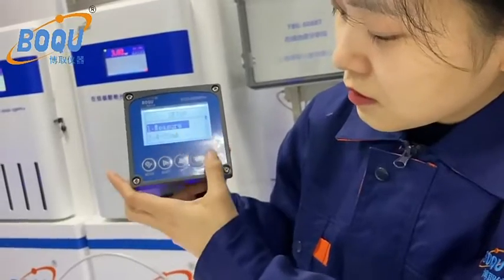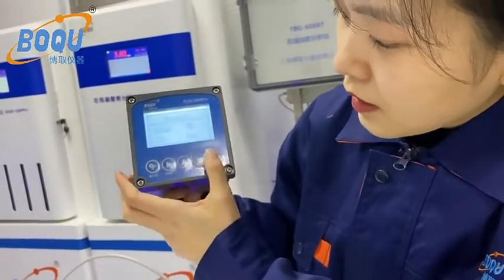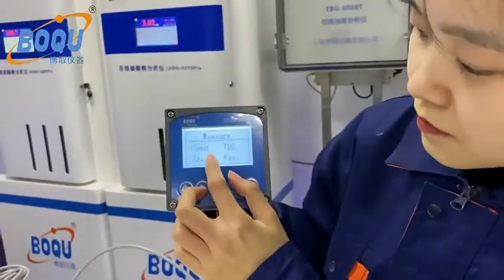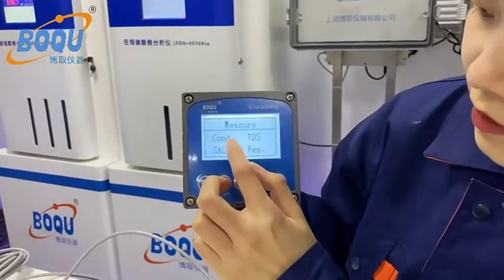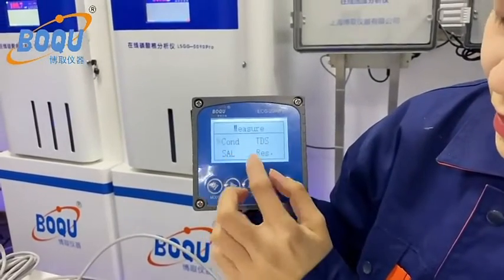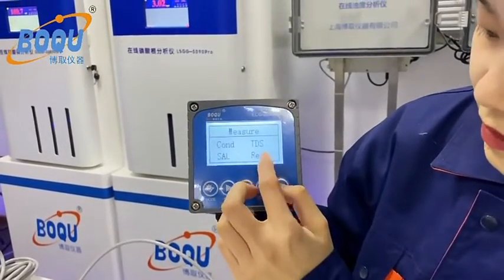The first one is measure. It can measure four parameters: the conductivity, the TDS, salinity, and the resistivity.